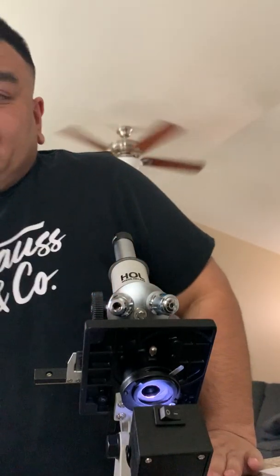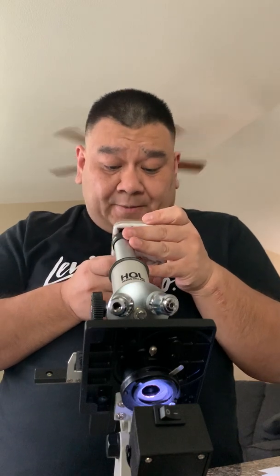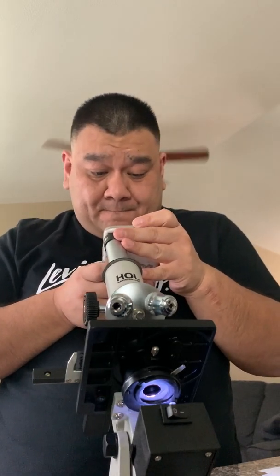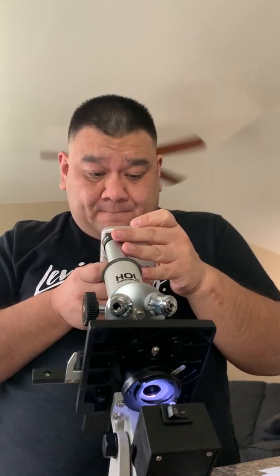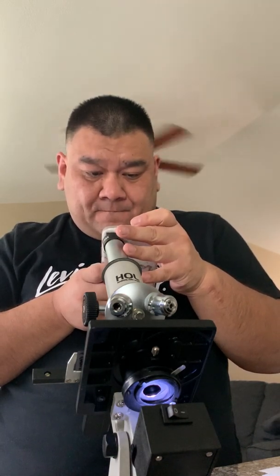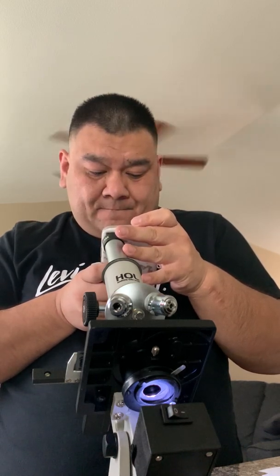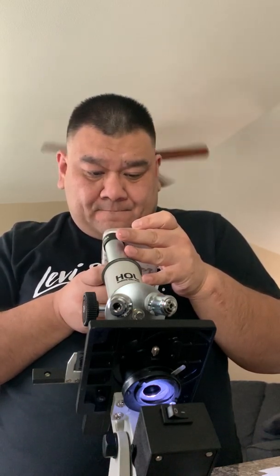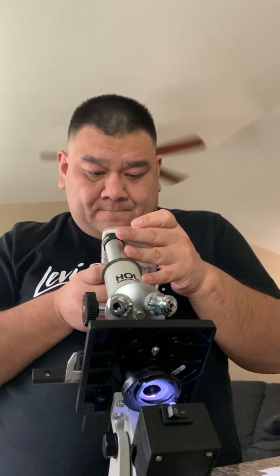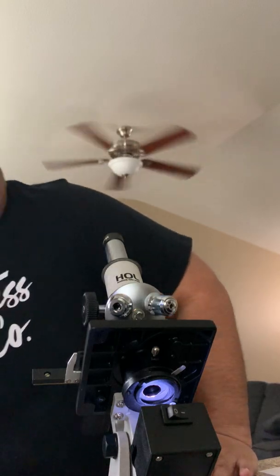All right, let me just take a picture of it for my data sheet.